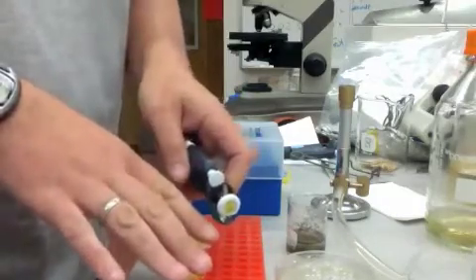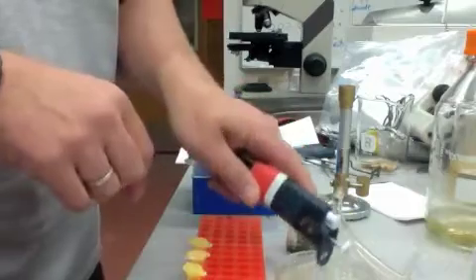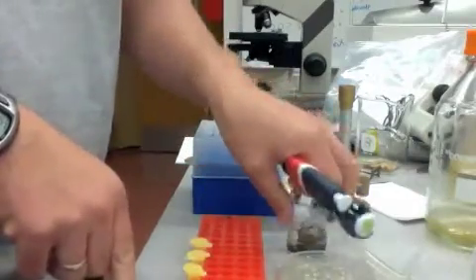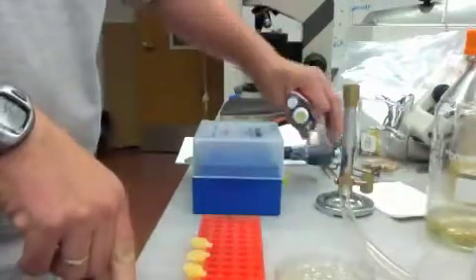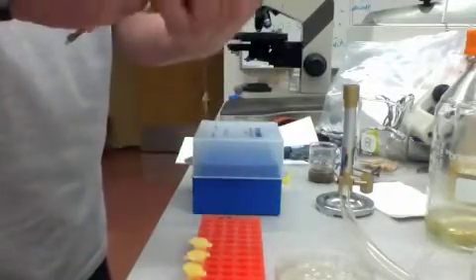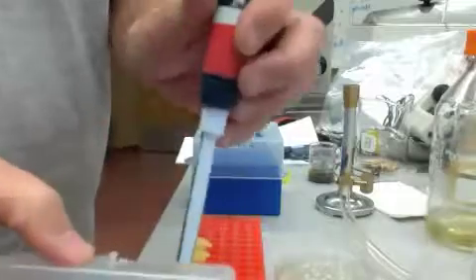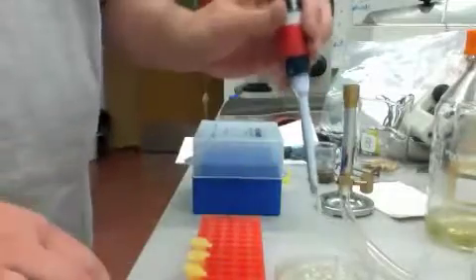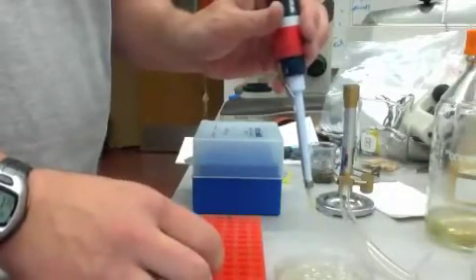Now for each of those, I want to plate out a volume onto my petri dish and spread it out. So I'm going to use my hockey stick method. So I set my pipette to 100 microliters.